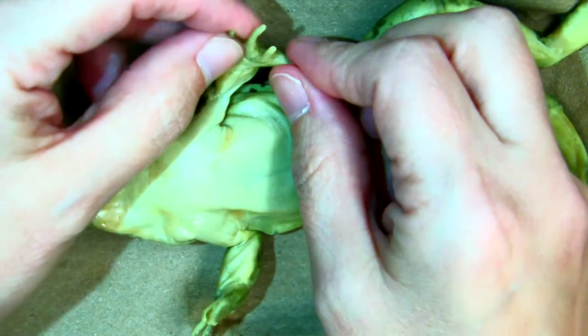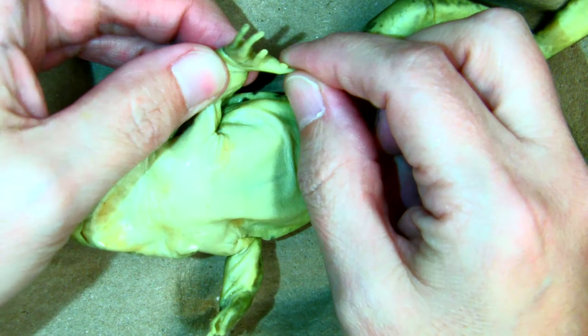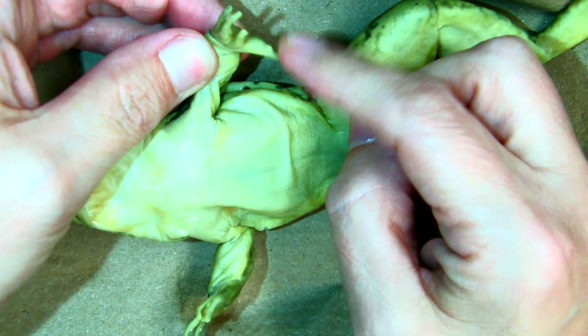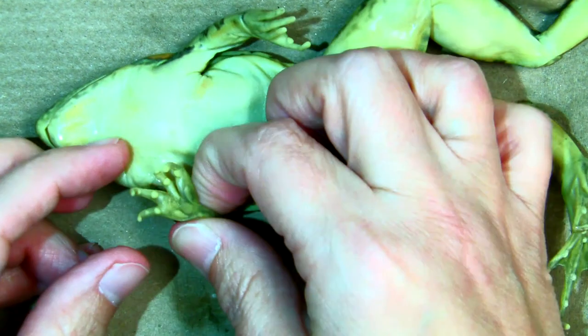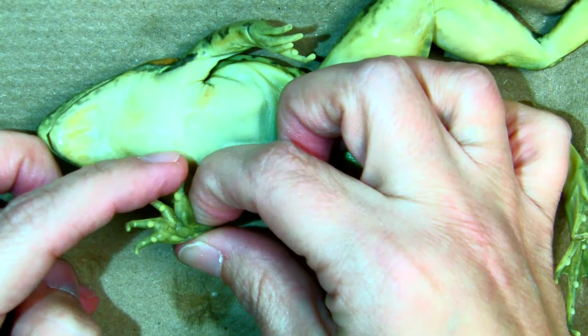If you look on the hand, they have four digits with the thumb on both hands. Four digits. This is the thumb.